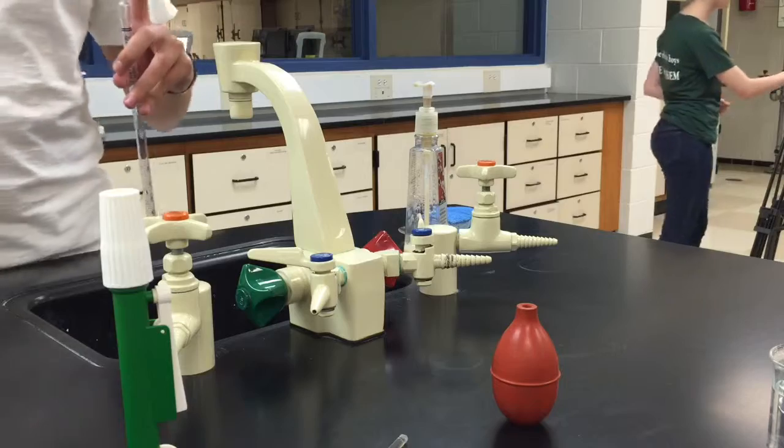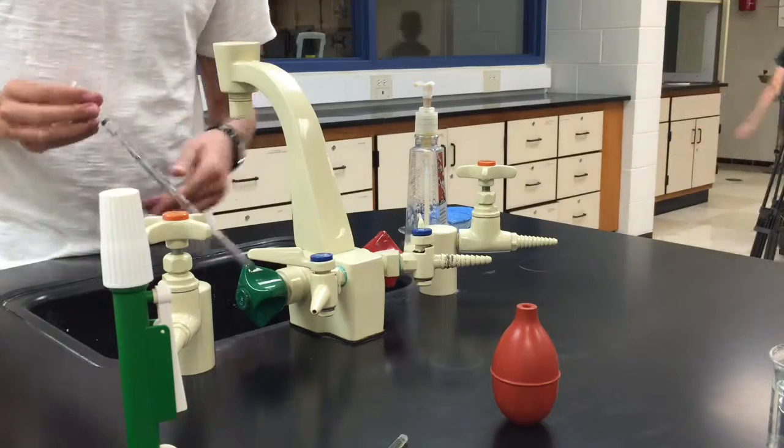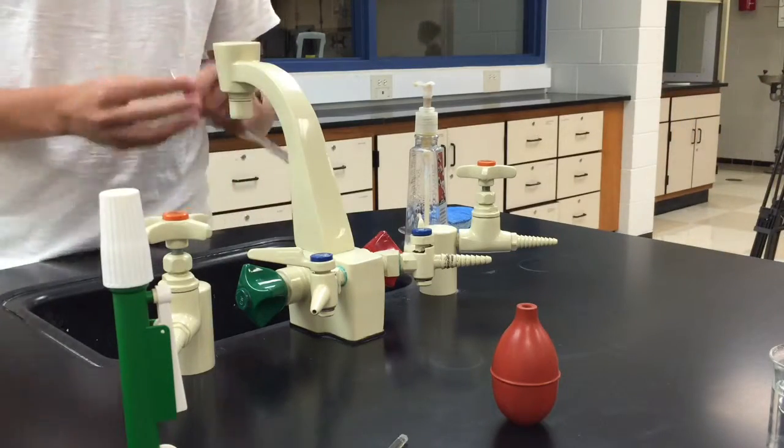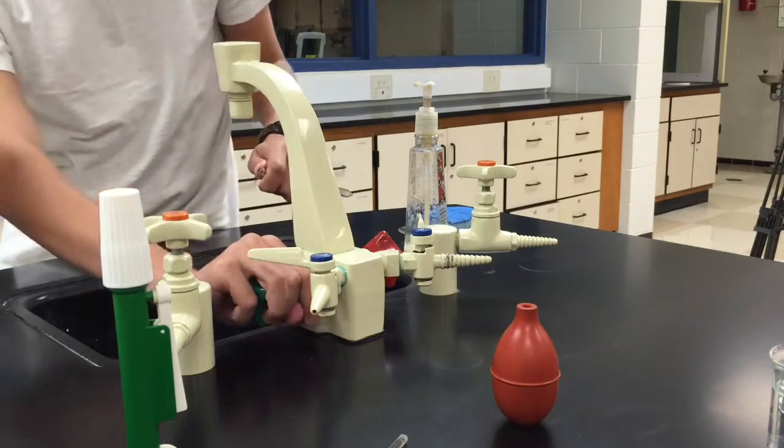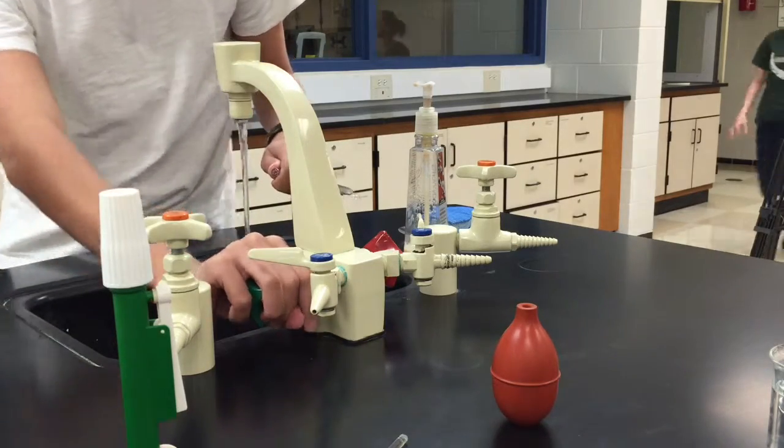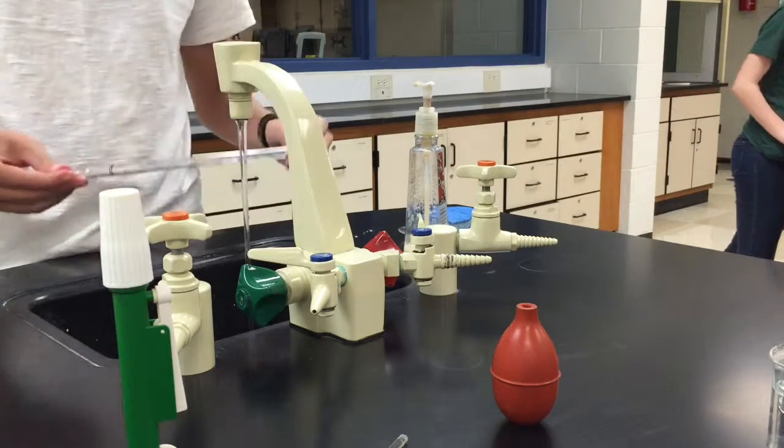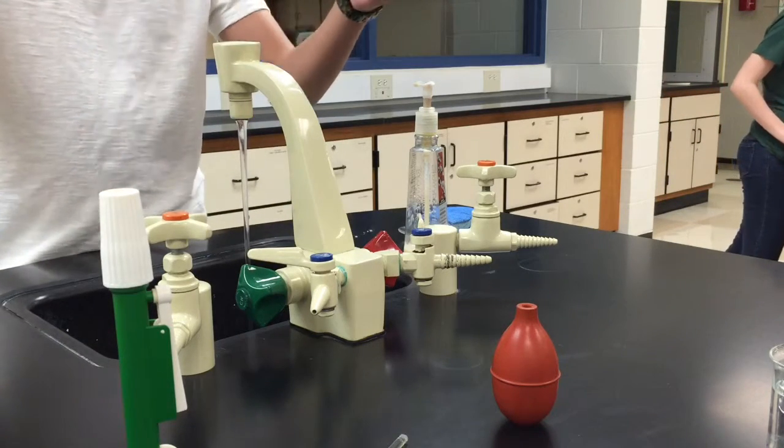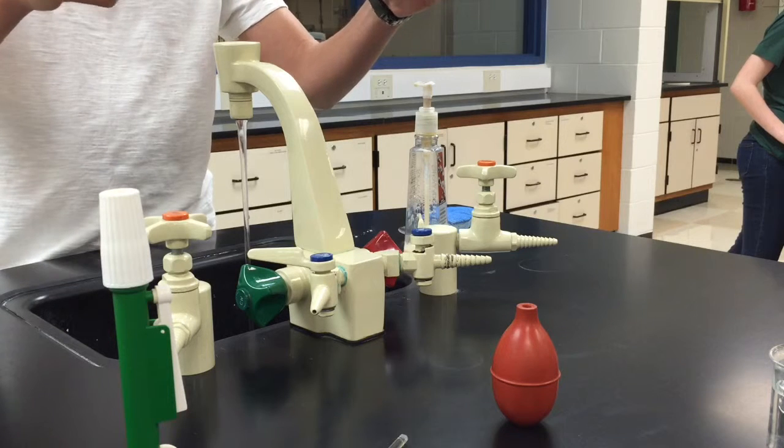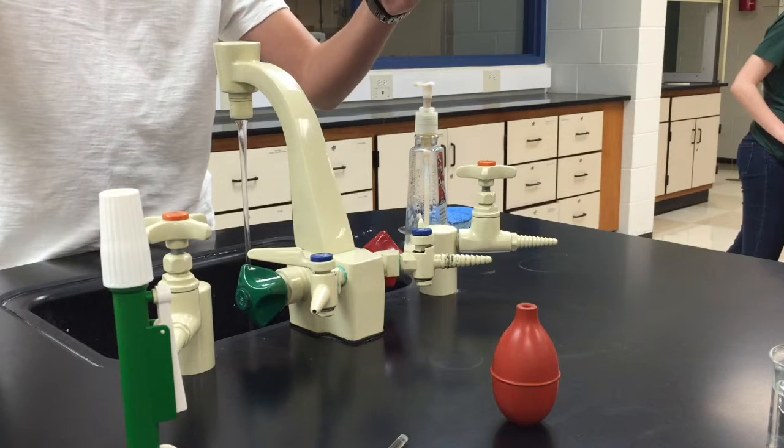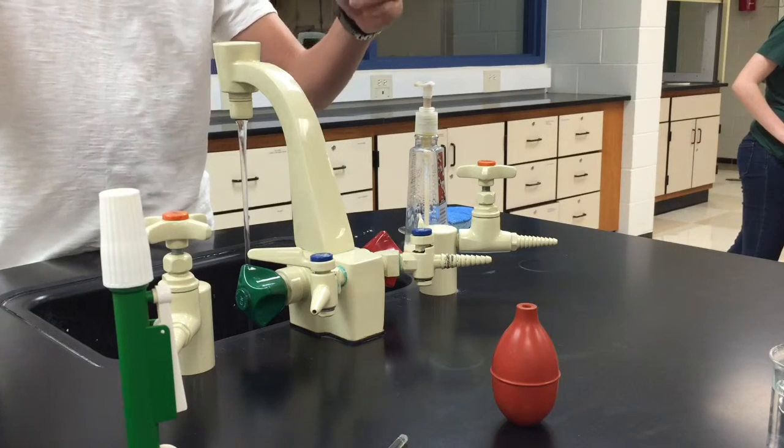Got some soap in there. Now, one of the more important techniques with the pipette is rinsing it properly. Turn the water on just a little. And now I have some water in my pipette. And what I'm doing is I'm rotating it so the water gets to all the surfaces inside the pipette and thoroughly washes it out.